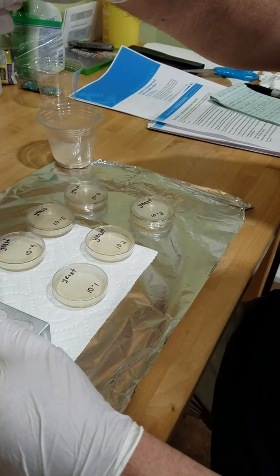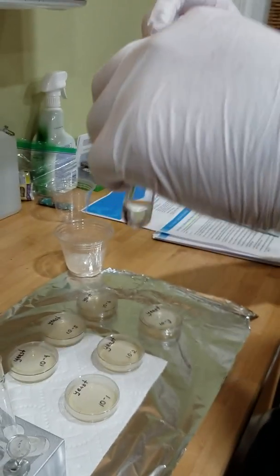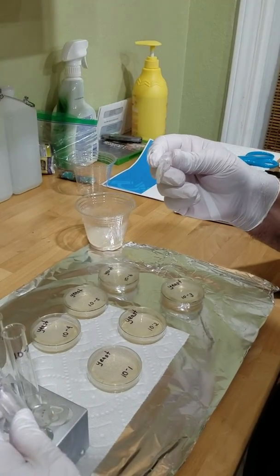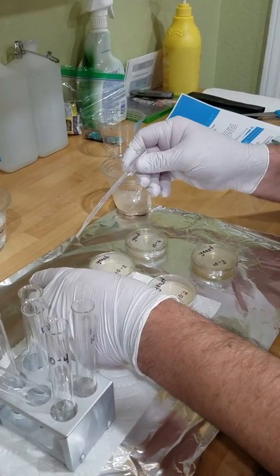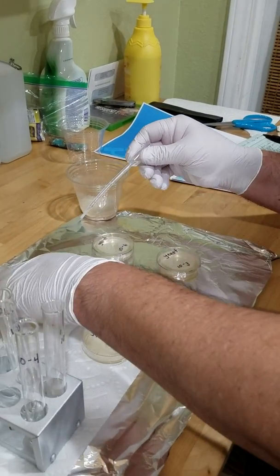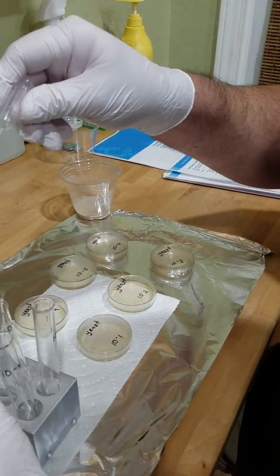Let's go ahead and do number 4. Number 4, 4 drops. 4. Get around there.